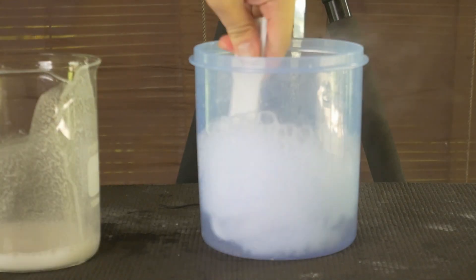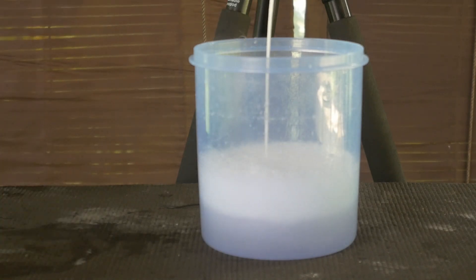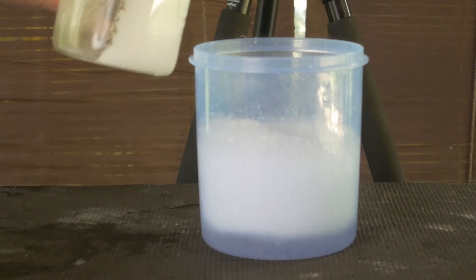You really want to add this stuff slowly because you will see why in a minute. You will see exactly what's going to happen if you do not add it slowly.